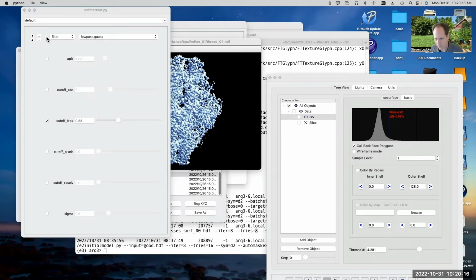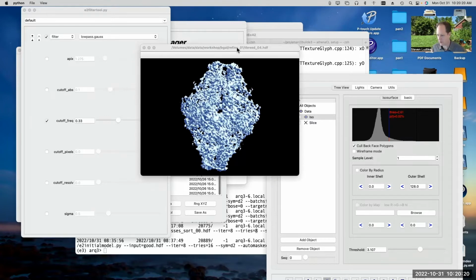So this is where it's important to point out that Gaussian low pass filters are sequential. Meaning if you low pass filter something to 4 angstroms and then you low pass filter that volume to 4 angstroms again, it's not going to stay the same. It's going to be filtered some more, and you're going to wind up with an effective filter of something like 6 angstroms instead of 4 angstroms if you do that.